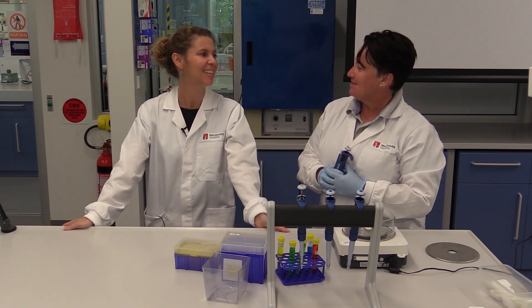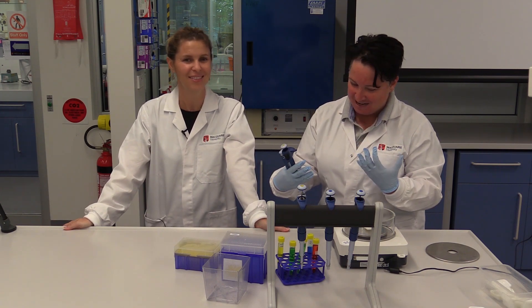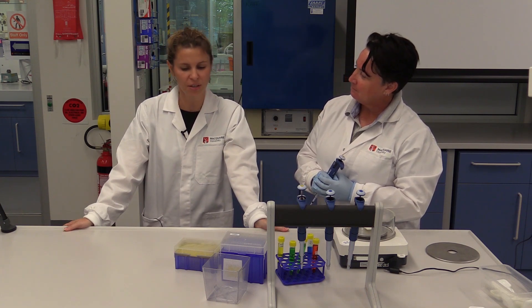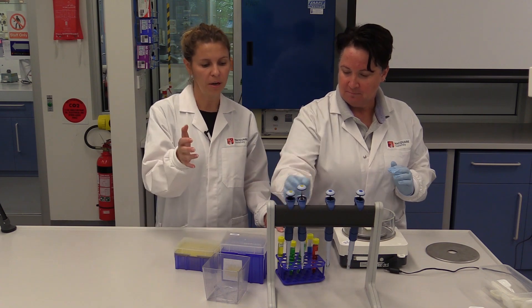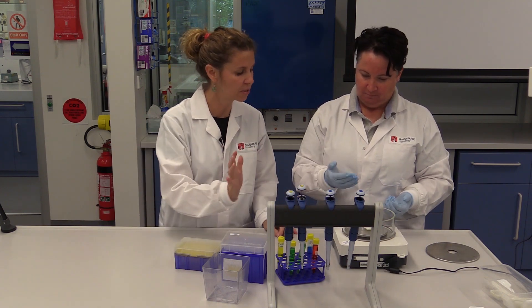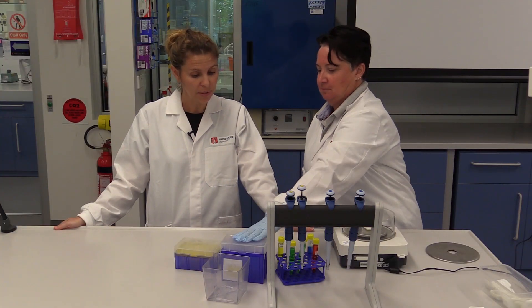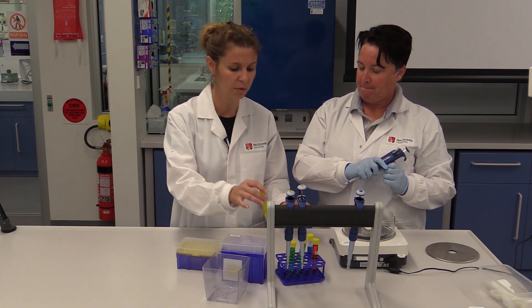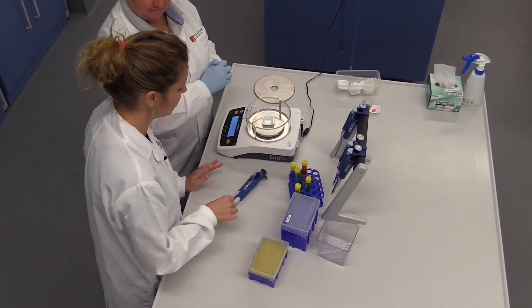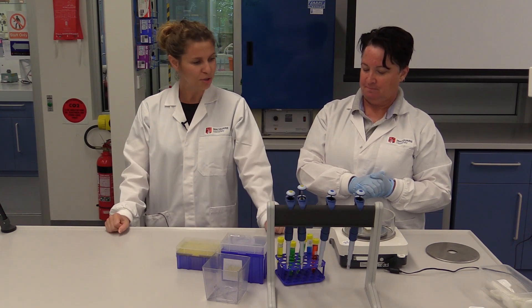So, there are some simple mistakes we can make — and we're being a bit silly here, just exaggerating some of the errors. But make sure that you take the right tip, the right pipette, upright position, dispense slowly, and tare your balance. Lots of people get messed up — they just flick it around. So go slowly, put it on your support, and you should be good.